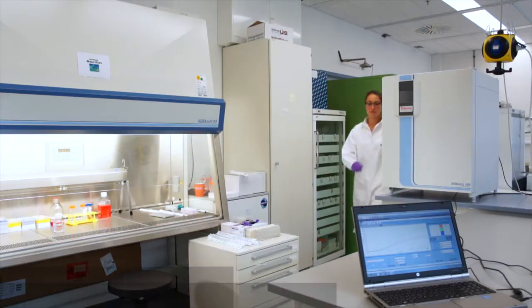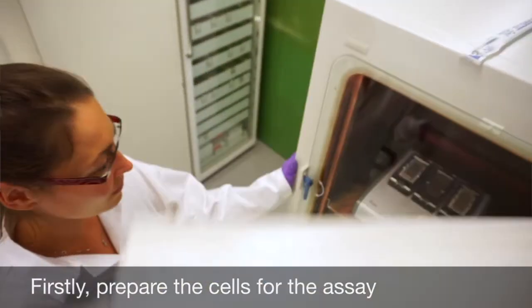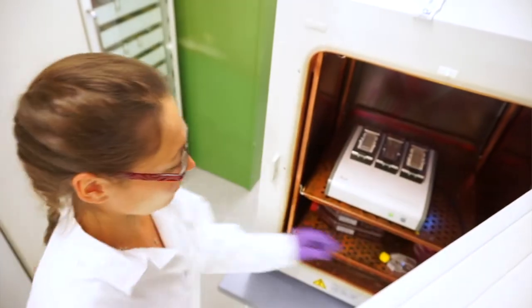First of all, prepare your cell suspension. Detach your cells as usual using an enzyme solution.